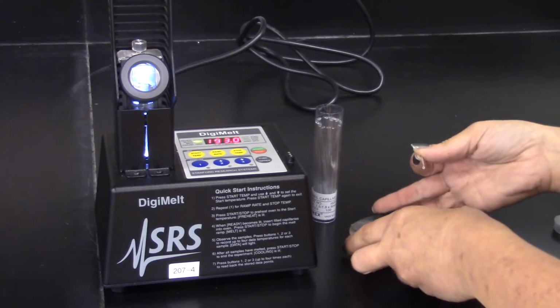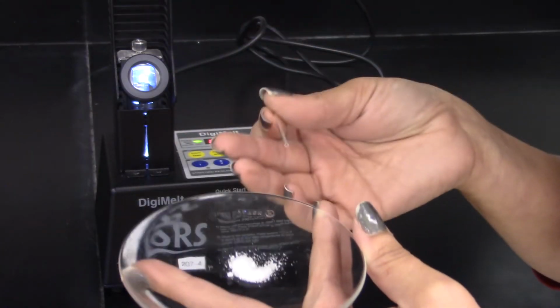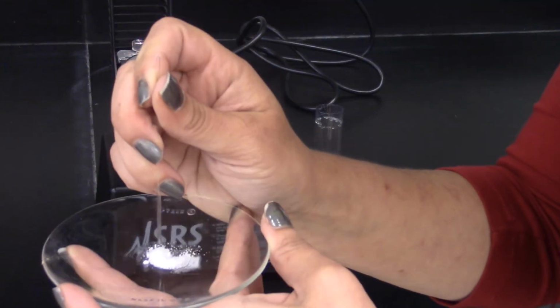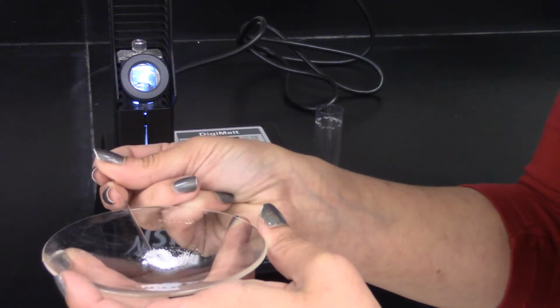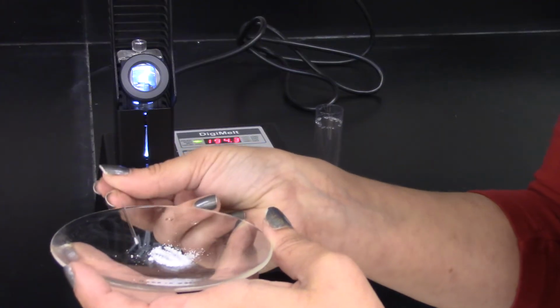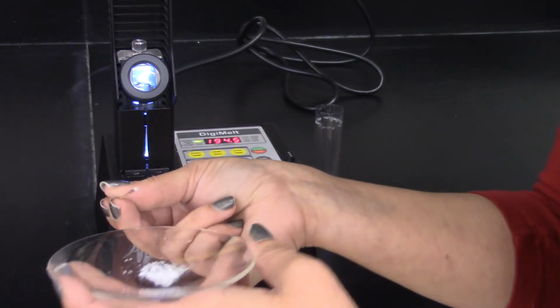So what you're going to do is take your compound on a watch glass or a weighing dish, and you're going to take the open end of the tube and you're just going to tap it into the solid, and sometimes you have to scoop it a little bit until you've got about 1 millimeter or 2 inside the tube. Then you should wipe away the outside. You can use a Chem wipe for this.